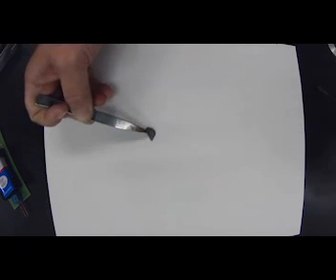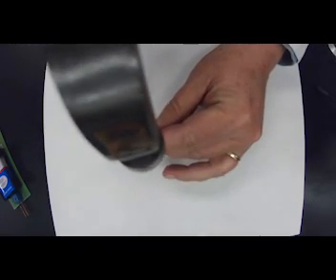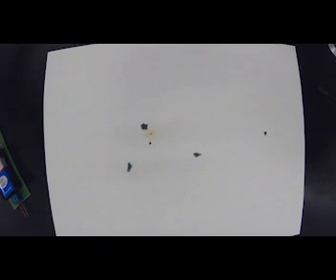It is a solid. So the first thing we want to say is color. It's dark gray. Luster. It sparkles, but yet it's also dull. So I would say no. Other physical properties, it is a solid. Notice it's already turning my paper yellow. So it leaks. Let's see what the result of tapping is. Is it brittle or not brittle? And there it goes, it breaks up, and so it definitely is brittle.